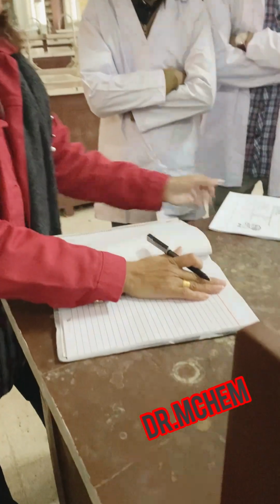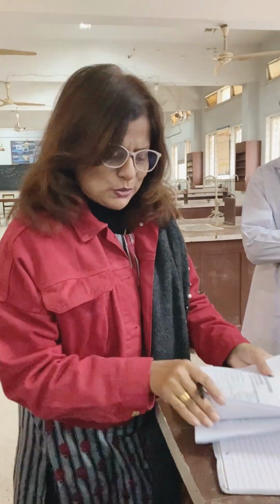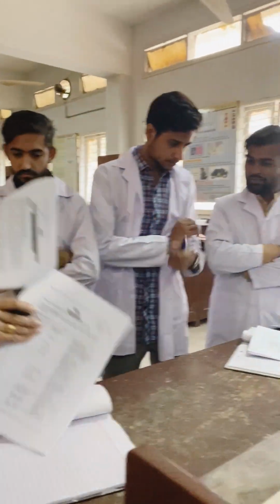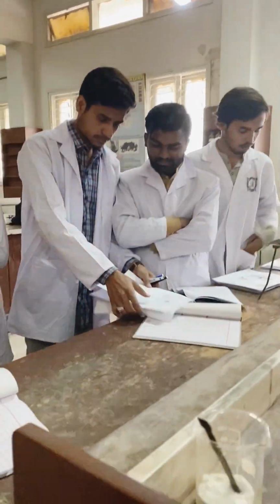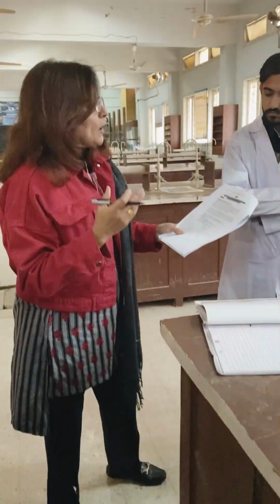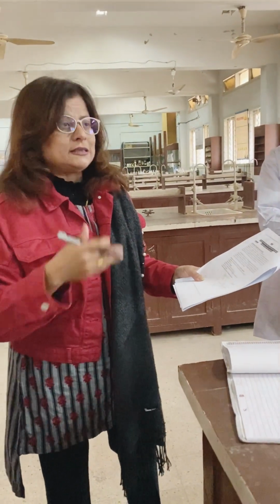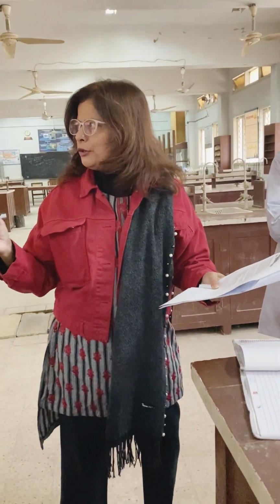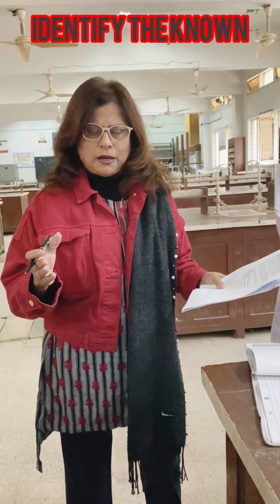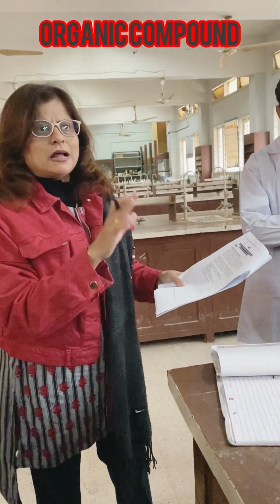So I'm going to tell you, this is the scheme, right? This is your scheme. And I told you that on page number 23 you are going to start this semester's work. They told you, as I just explained, that you are going to identify an organic compound. So you now have a known organic compound. Today we are going to start, as I told you in your demonstration, with a known organic compound. So today I'm going to give you para-nitroacetanilide.